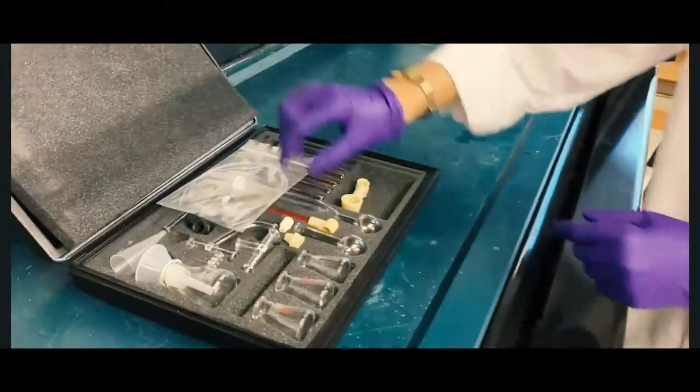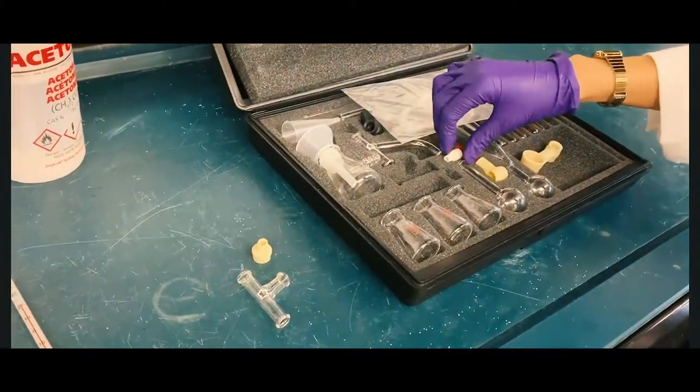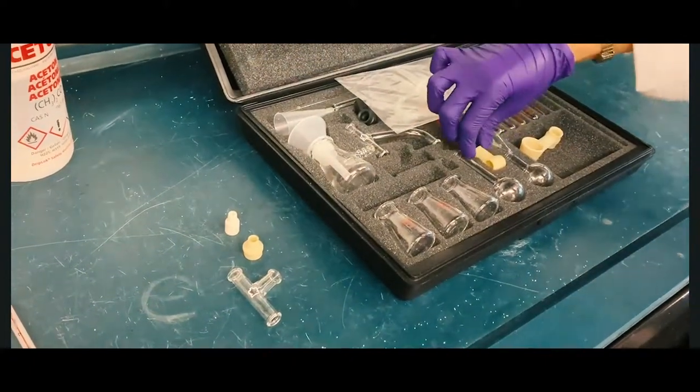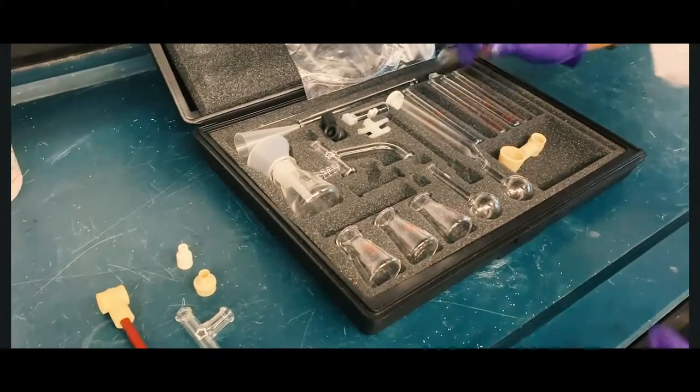For the boiling point, grab the connecting adapter, the thermometer adapter, a rubber stopper sleeve, a connector with support rod, and a reaction tube from your Microscale kit.